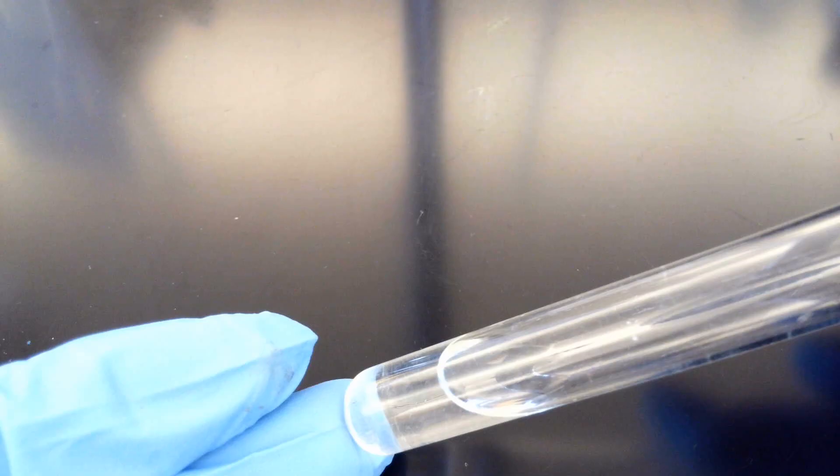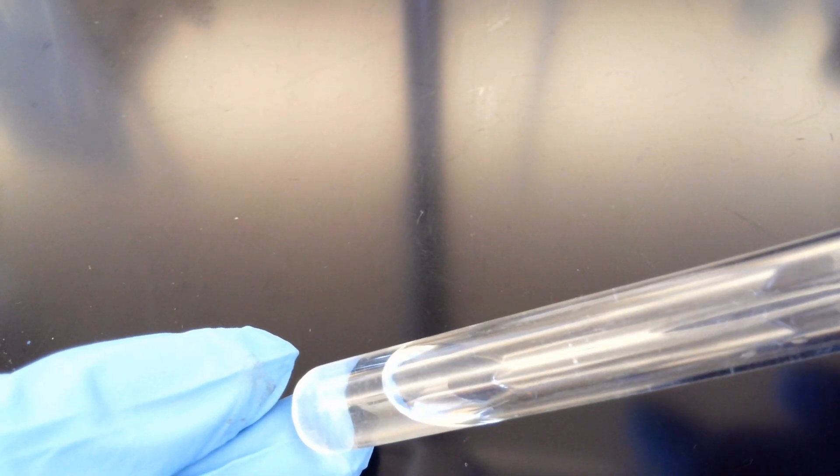For our second test, we added NaOH. Here's our unknown with NaOH. There was no reaction.